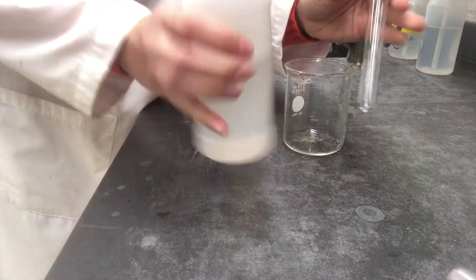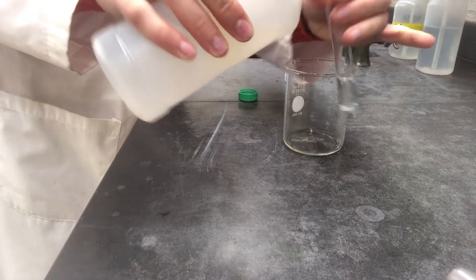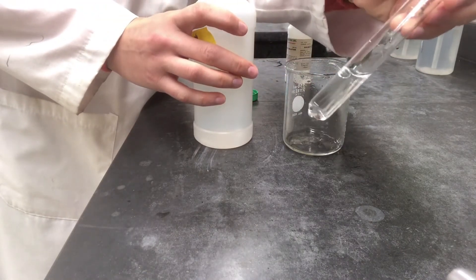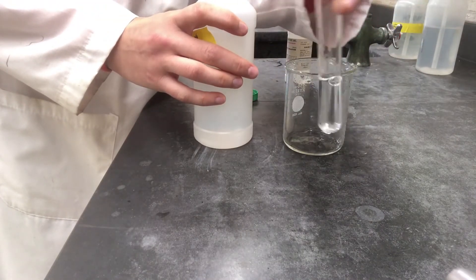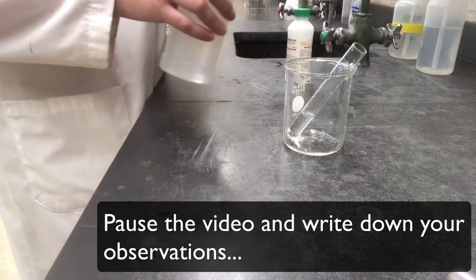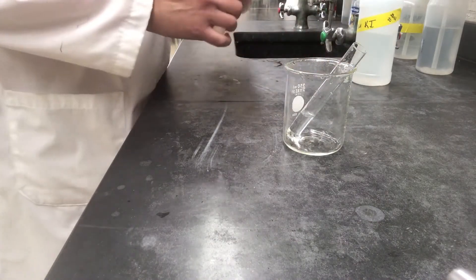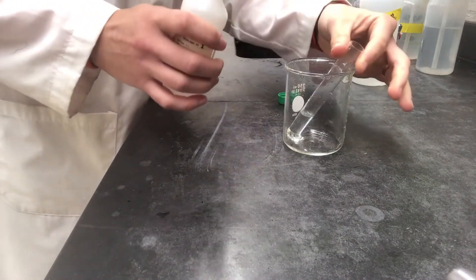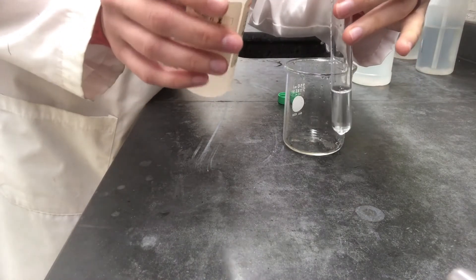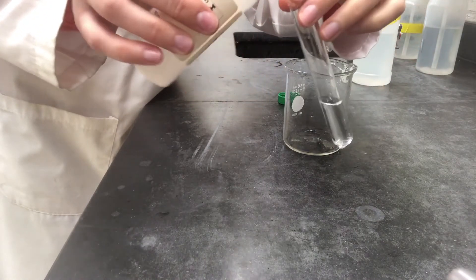For this next demo I'm going to pour some potassium iodide solution into this test tube, so make a couple of observations — what do you notice about your potassium iodide solution? Then to that solution I'm going to add a second chemical called lead nitrate, and I want you to observe what happens when I do so.